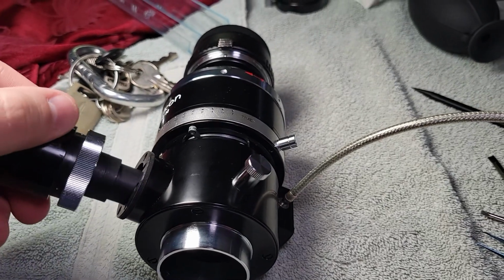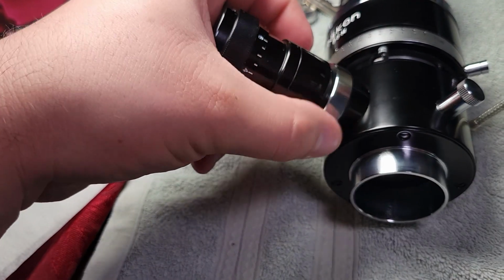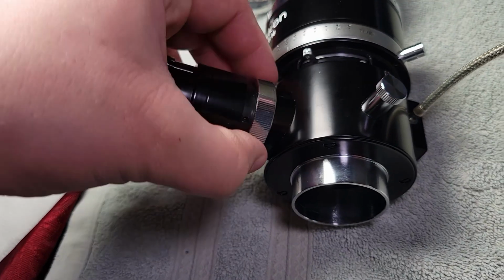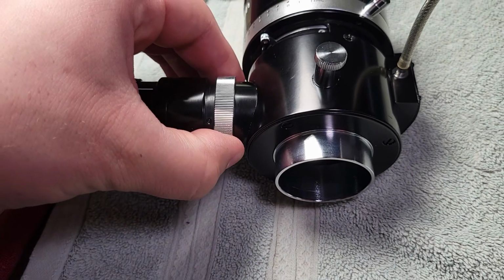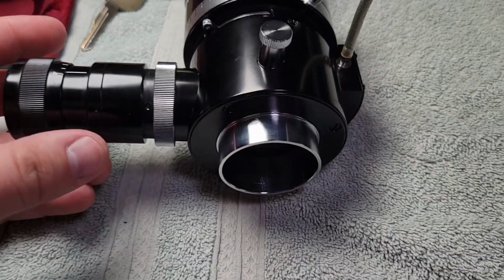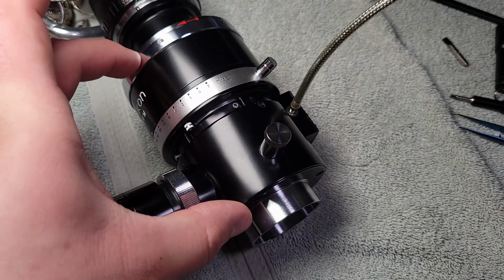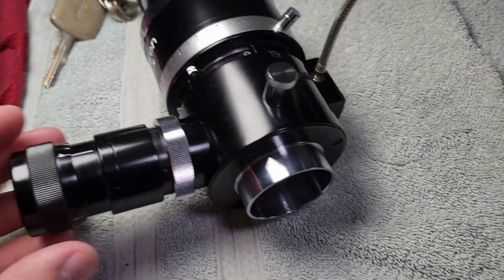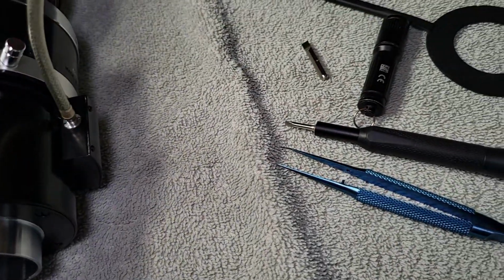But this is a really, really fun mechanism. Really interesting parts. I don't understand this thing. This is the one part I was ranting about, spanner nuts and right to repair and all this stuff. This is literally the only nut on here that is not a spanner nut. Everything else is. There's literally like 5 or 6 of them in just those two main pieces.